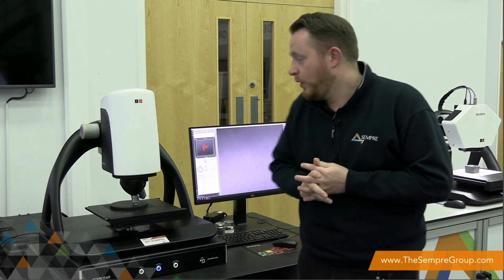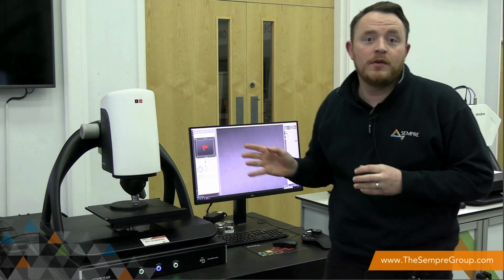So first we're going to take a look at interferometry techniques. So what we're going to do is run through a breakdown of the different technologies and the reasons as to why we would use them. We'll go into the 3 measurement techniques that we have for interferometry, and then we're going to run through a measure sample and show you how it's done basically.